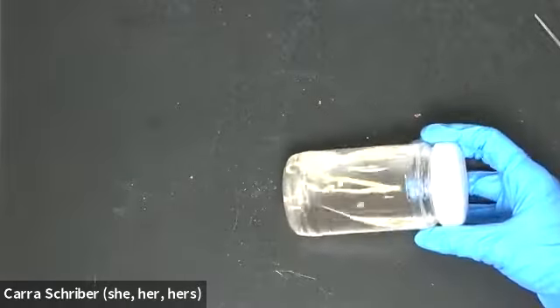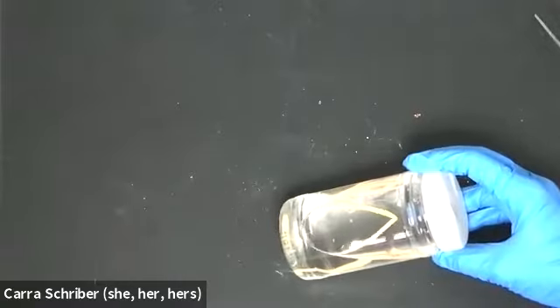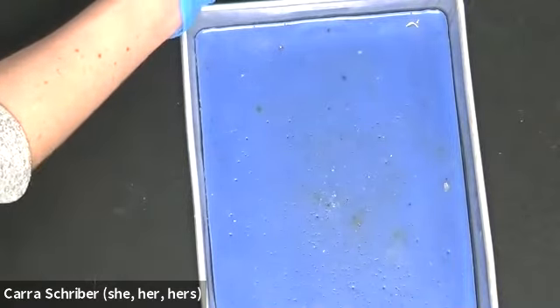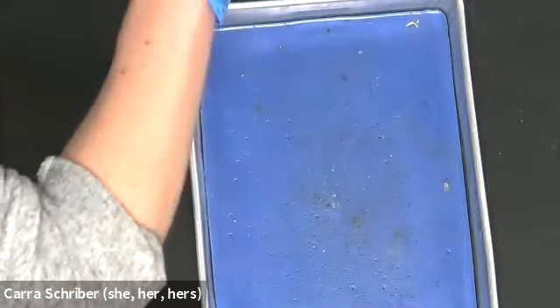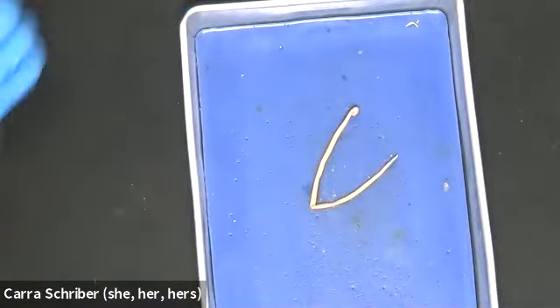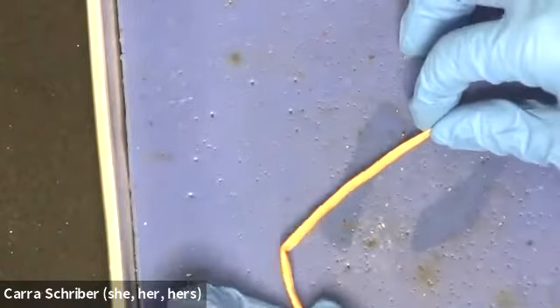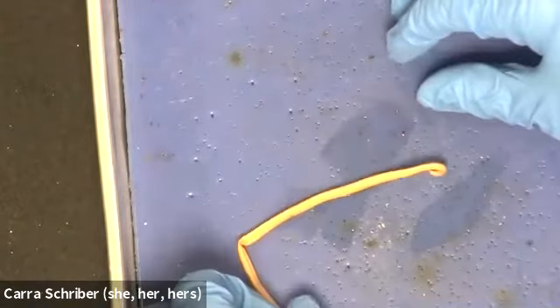All right, let's compare that really quickly to our roundworms. And I'm just going to show you one example of a roundworm because there's nothing to write home about. This is literally just kind of like a white sac here. I'll do more of this when we do the dissection, but just so that you can see how simple this form is. So roundworms have a pseudocoelom, meaning that they have kind of a false coelom, and their body is pretty straightforward here. So this guy is probably old, so I'm not going to unbend him too much.